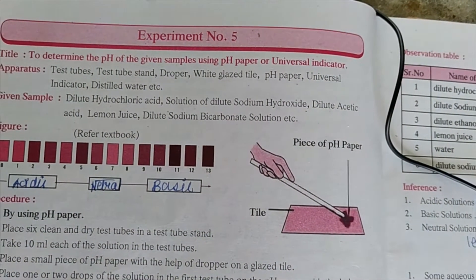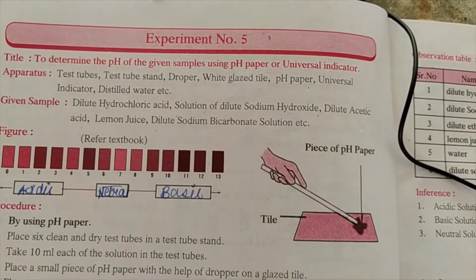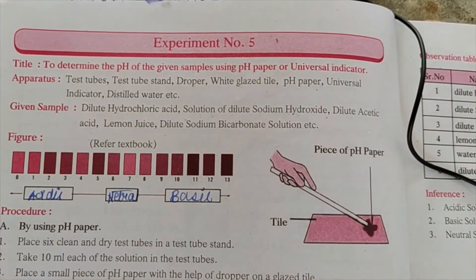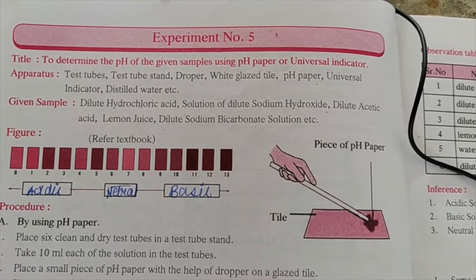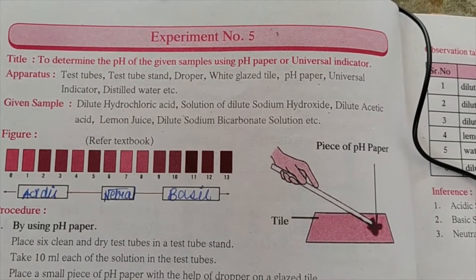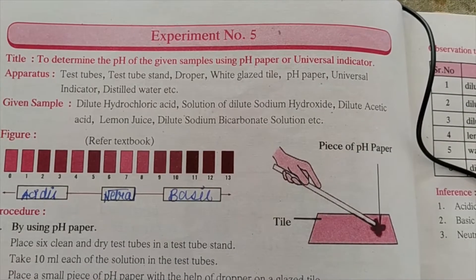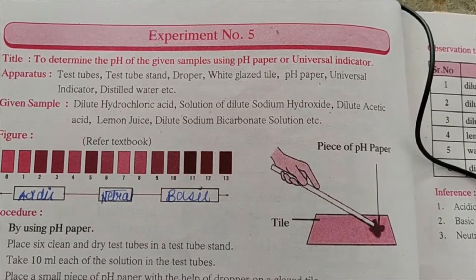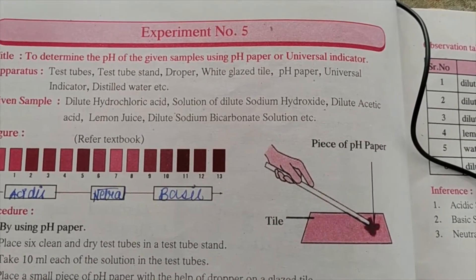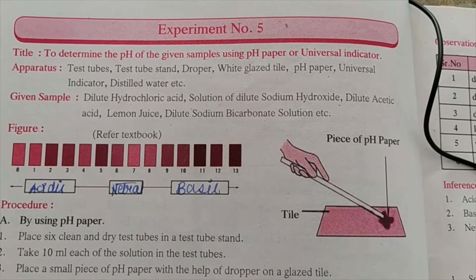Hello dear students. Today we are going to see experiment number 5. The title of the experiment is to determine the pH of the given sample using pH paper or universal indicator. Now we are going to use universal indicator.